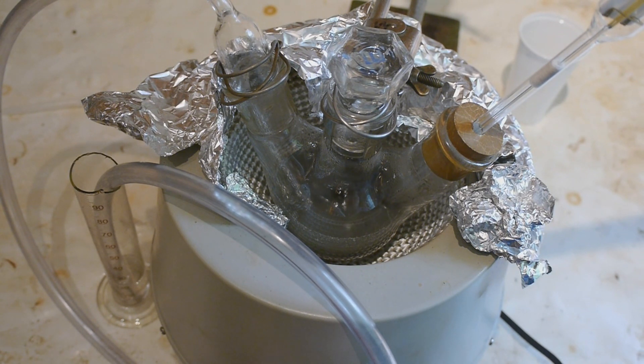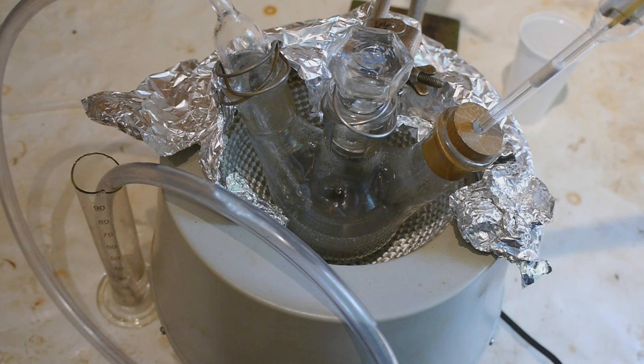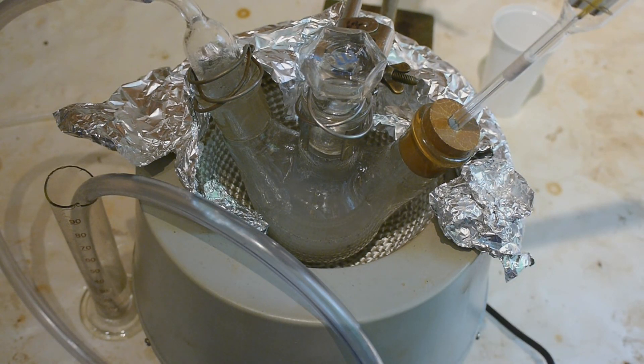I have overheated this a little bit. We are now at 240 degrees, so I hope that's not a big deal. Looks like it's boiling. Maybe that caused some of the menthol to boil off, so we might have to add some more. But I can't smell it in the bubbler.